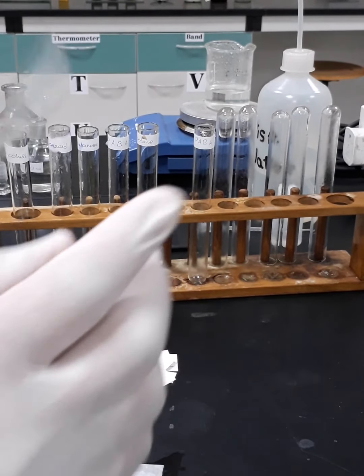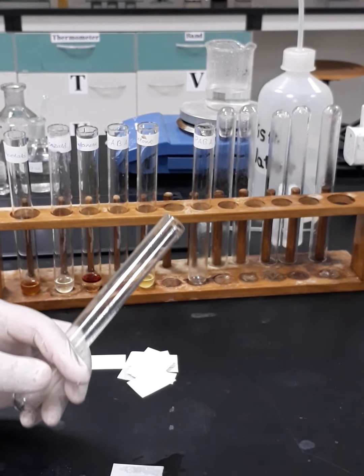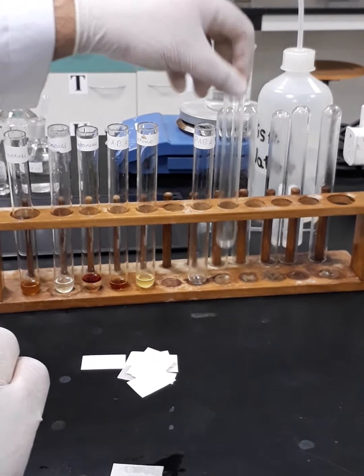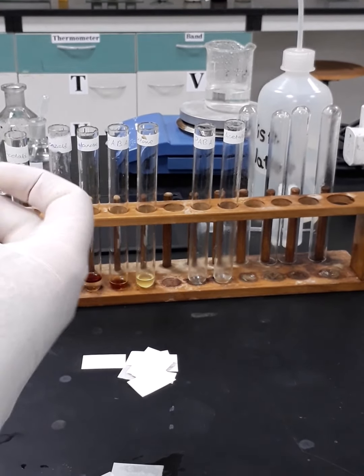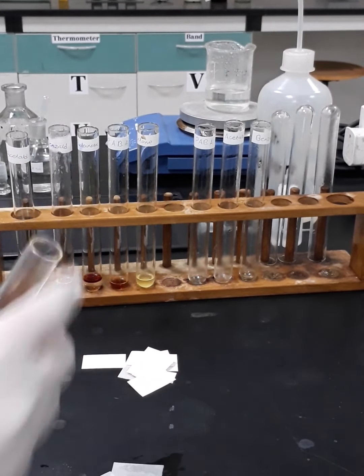Okay, then we will proceed with acetaldehyde. Acetaldehyde, okay. Then benzaldehyde. Okay, then butanone.